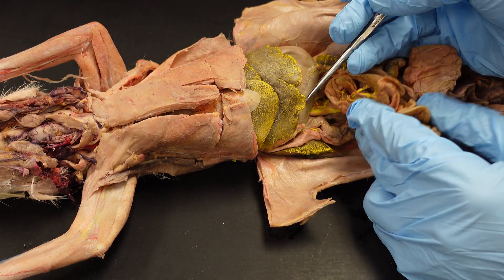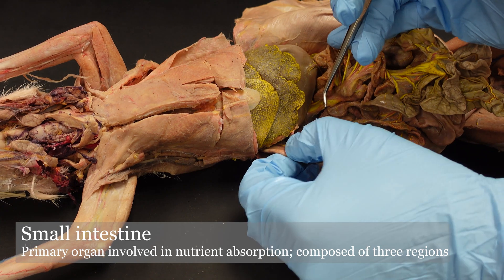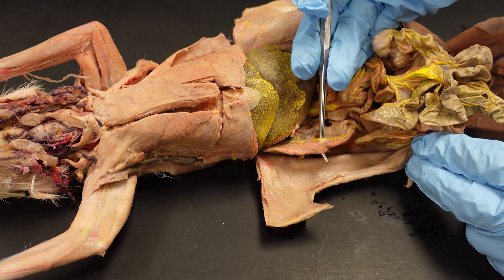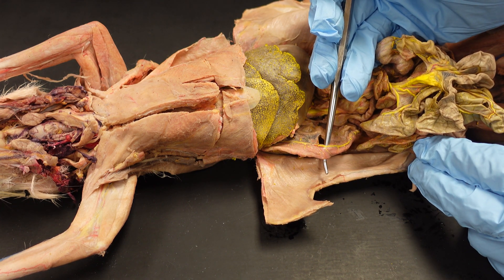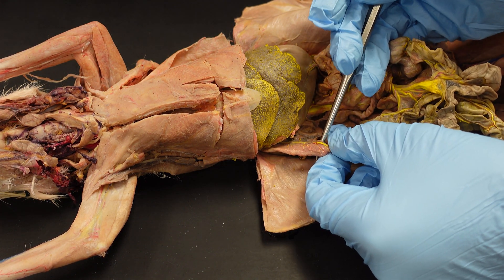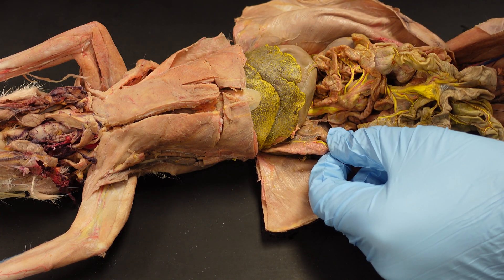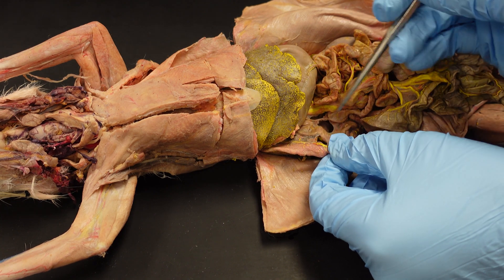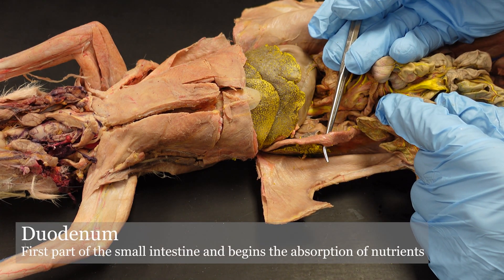From the stomach, we empty out into the small intestine. The small intestine is made up of three parts. We're not going to go into the internal anatomy of the small intestine, so we won't actually see the major differences, but we could ask you conceptual questions like what are the three parts of the small intestine in order — something along those lines.